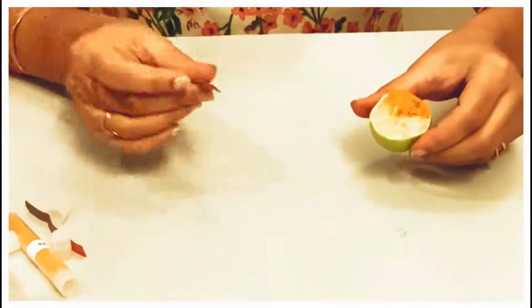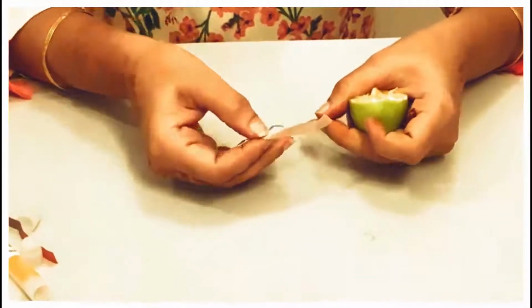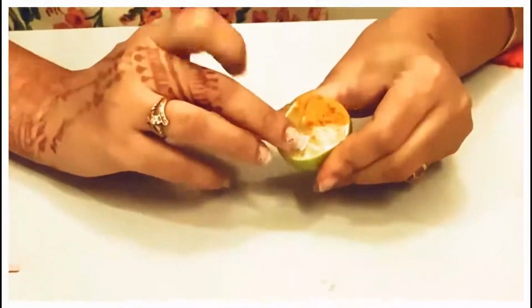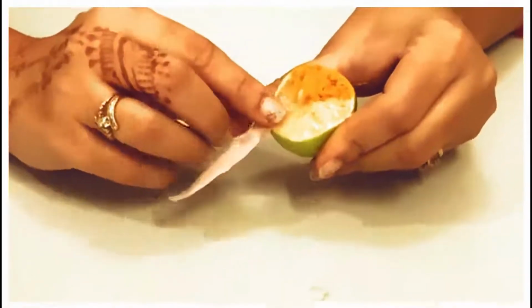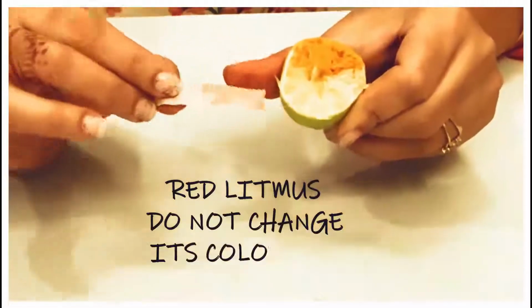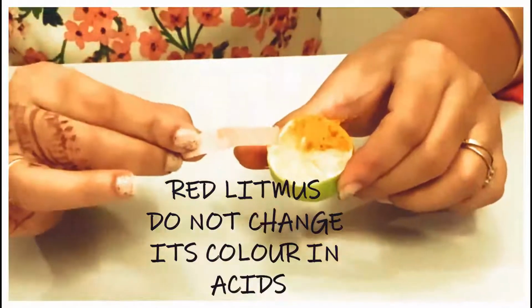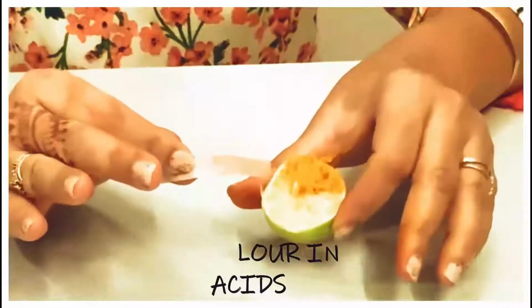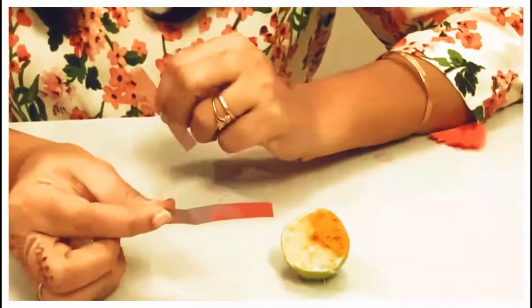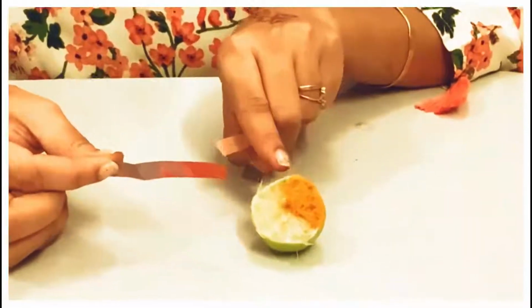Let us double check it with the red litmus paper. Let me check what happens if I put red litmus into this citric acid. When I dip it in, it just gets wet and there is no change. So in acids, the red litmus paper has no change, while the blue litmus paper turns into red. You can also see here the turmeric also has no change in acids.